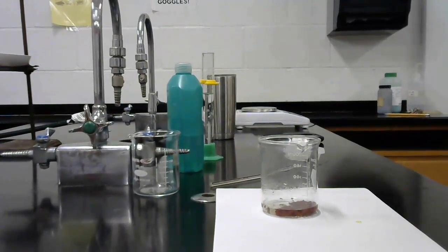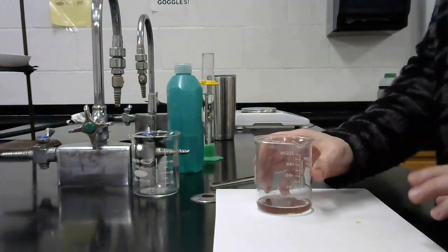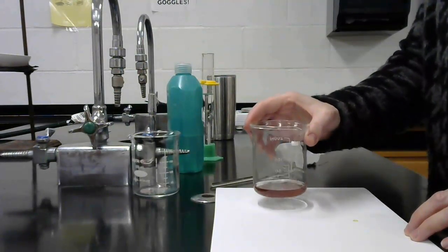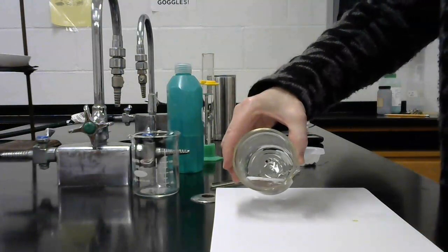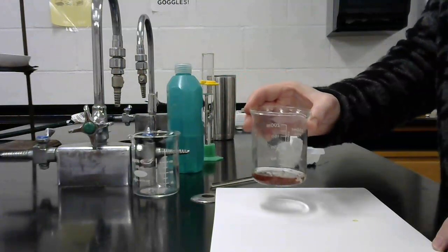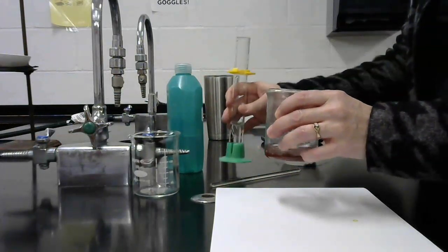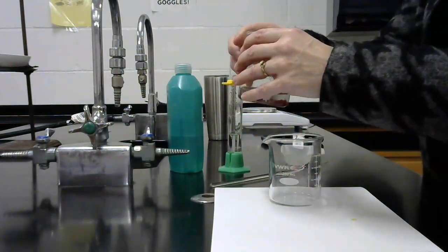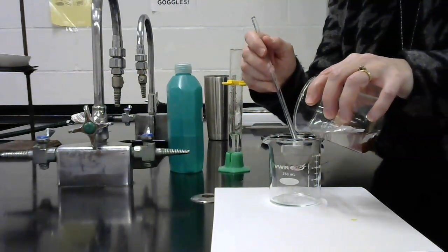So after I put the zinc strips into that solution, that green-blue solution, and that's a characteristic of a copper compound, sometimes they have that blue-green color. You can see my solution now is clear, and I have this precipitate in the bottom, and that precipitate is copper. So in other words, I got the copper to come out of the solution. So I'm going to rinse this. I want to collect that copper, a little water, and then I'm going to decant and keep the copper back in my beaker, and then that copper is going to be wet.